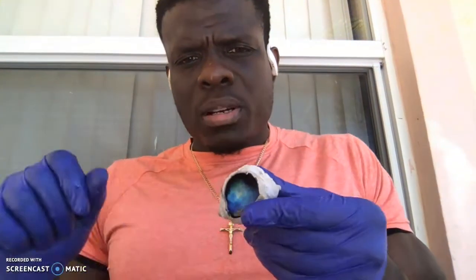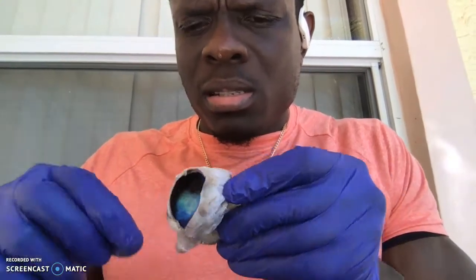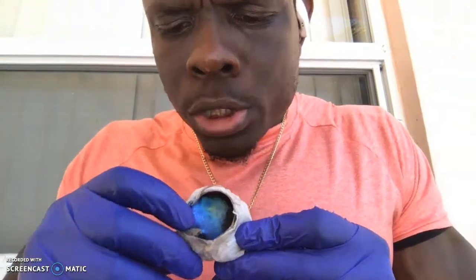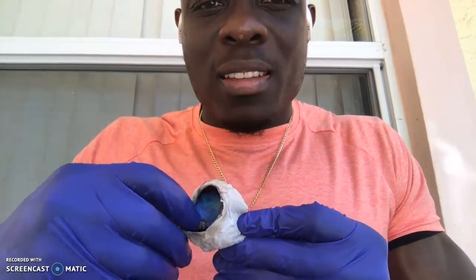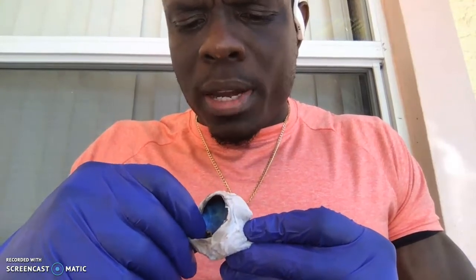So now moving on to the posterior side of things, make sure you can see it. Wow, I need a better angle so you can see it. This orange component right over here, or white component right over here, if I try to pull on this, I actually can't. That's because that's our retina right over here. So literally right over here is the retina.